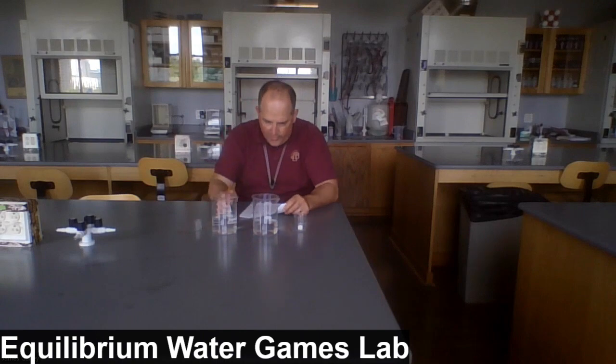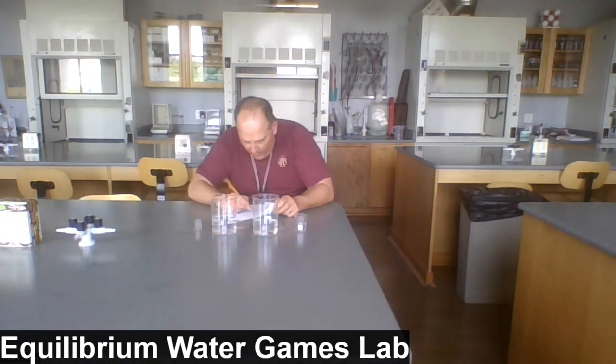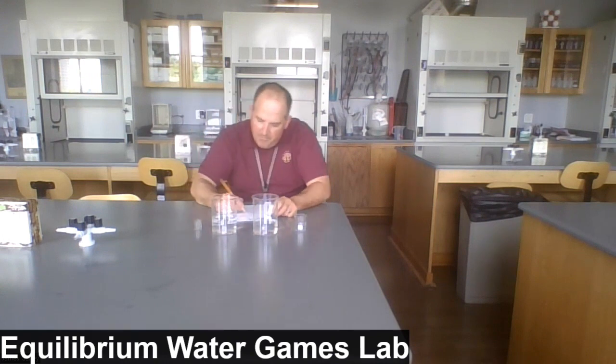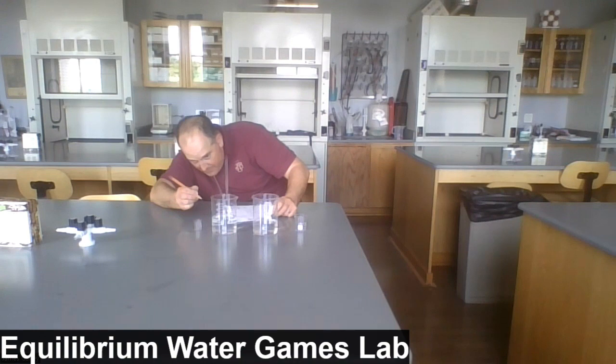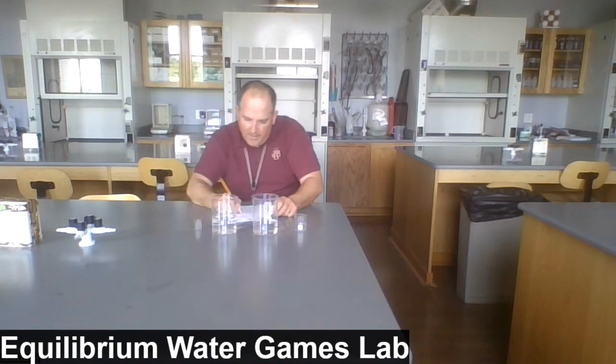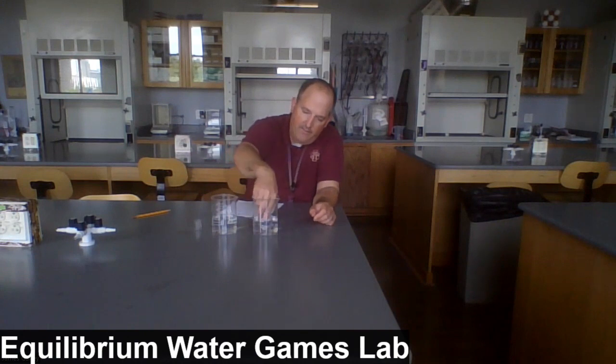Okay, so after transfer cycle 1, in beaker A, we're at 210 milliliters, and in beaker B, 290. Let's try again.